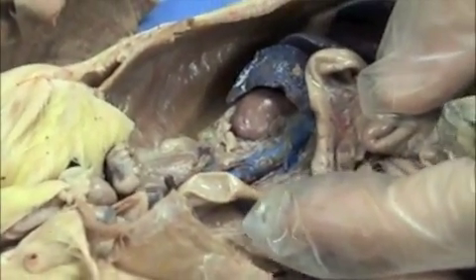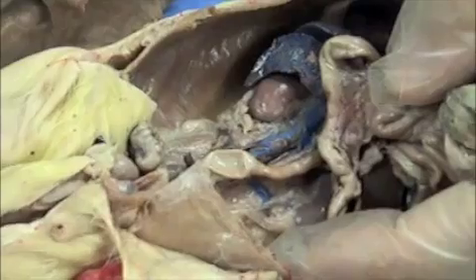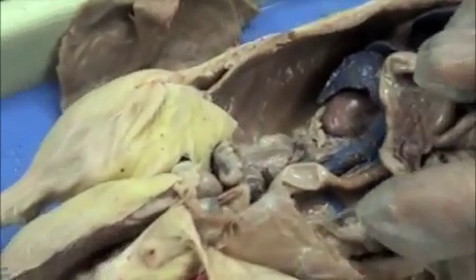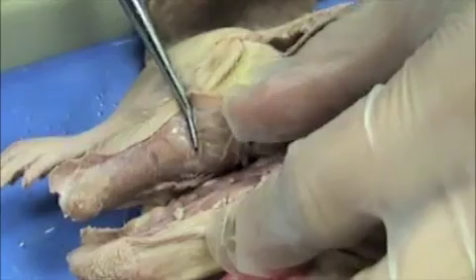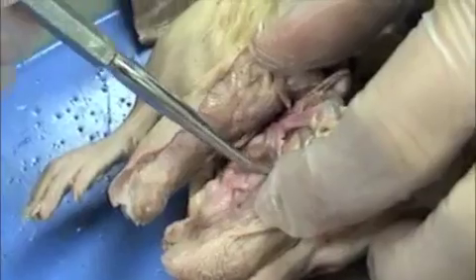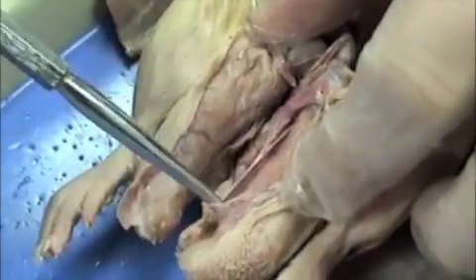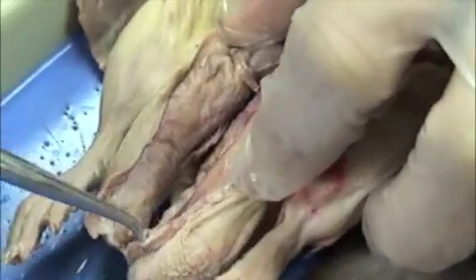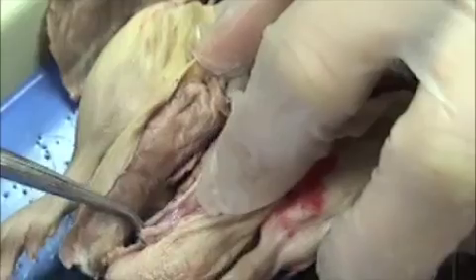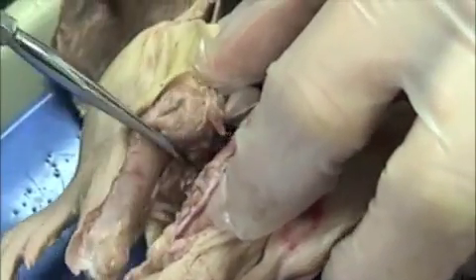This is a male rat, so the male reproductive structures are: these are the testes here, and they lie on the scrotal sac. There is the vas deferens — it's the tube that is going to carry the sperm from the testes up into the pelvic cavity.